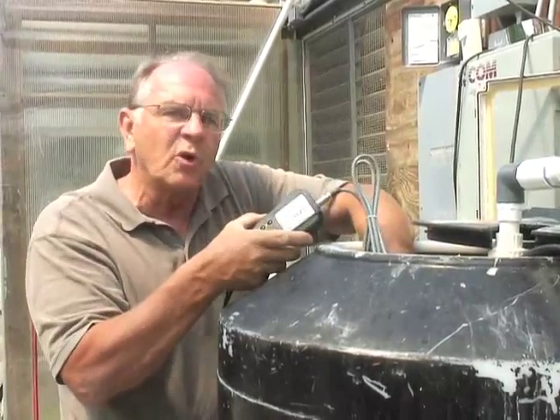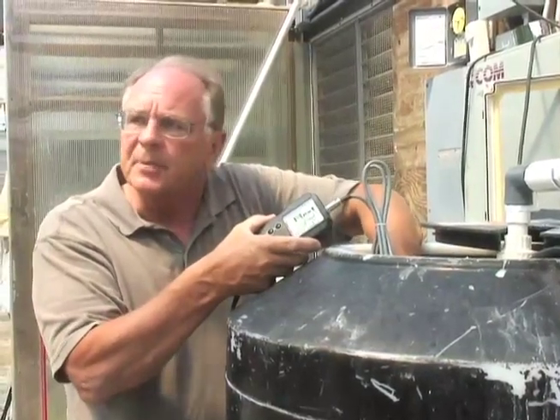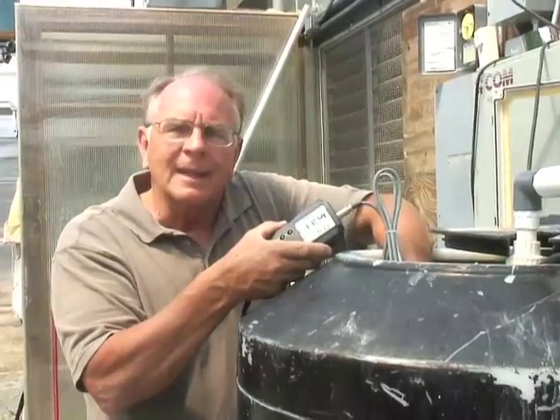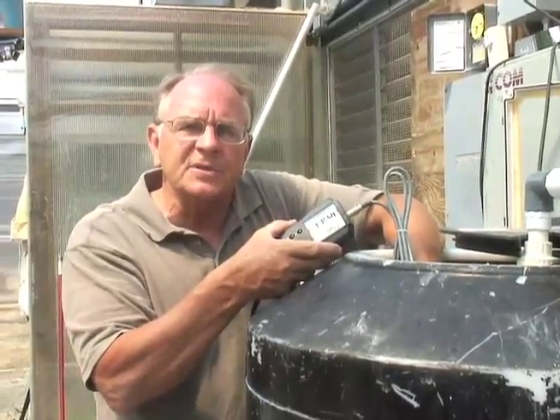Daily we can measure to make sure all our equipment is working so the plants can grow properly. That's how easy the 9813-6 is to use, and the importance is to keep a healthy crop.